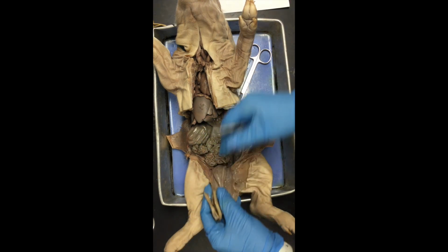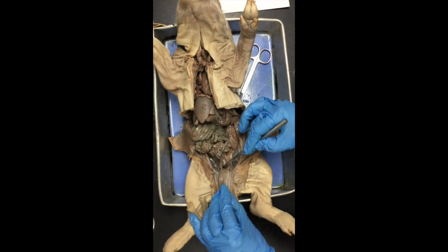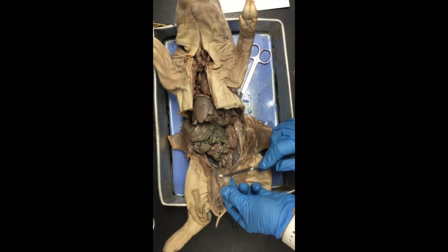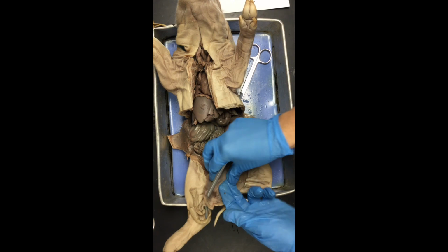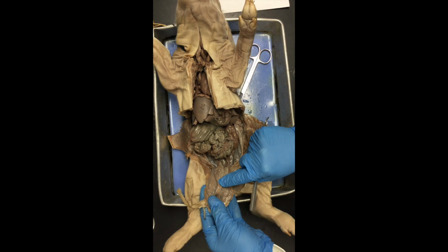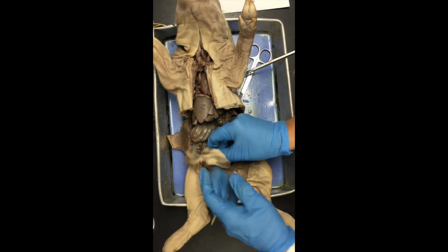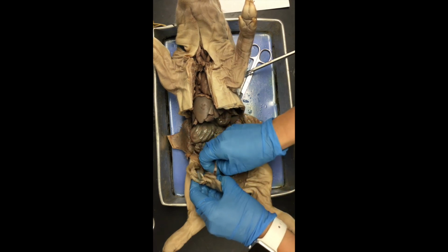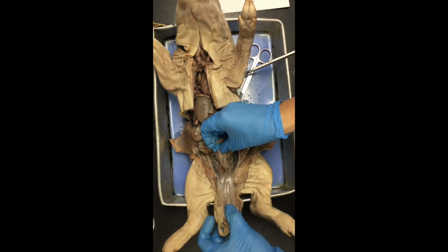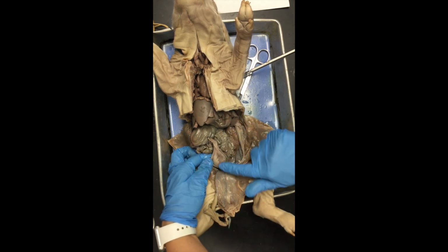Now, if you have a female, you can actually see ovaries down here behind the urinary bladder. This structure right here, I think I left it off. Let me point it out really quickly. This is the urinary bladder. If we flip it, this is where that umbilical cord was, and there's our urinary bladder right here. Usually what I recommend students do is go ahead and separate the urinary bladder from this area of skin right here. So we can pull on it a little bit, and then move this back, and we can see that urinary bladder more clearly right here.